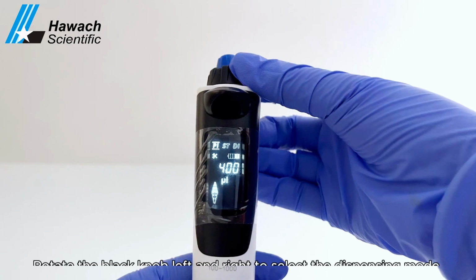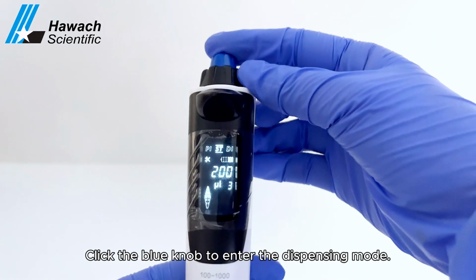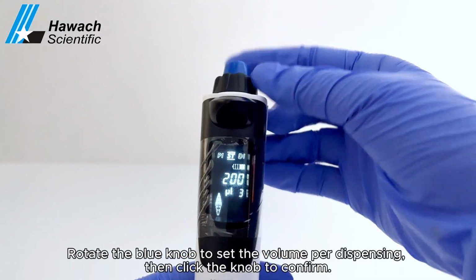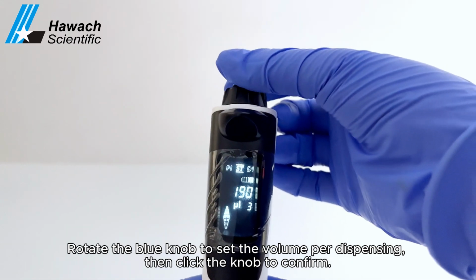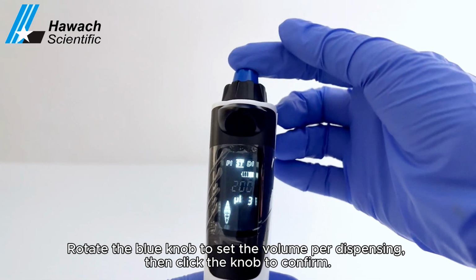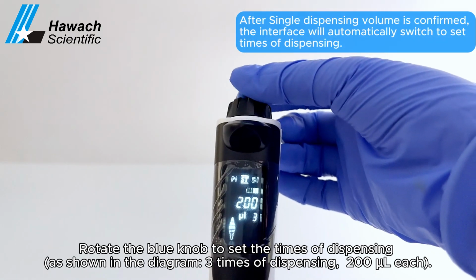Dispensing mode. Rotate the black knob left and right to select the dispensing mode. Click the blue knob to enter the dispensing mode. Rotate the blue knob to set the volume per dispensing. Then click the knob to confirm. Rotate the blue knob to set the times of dispensing.